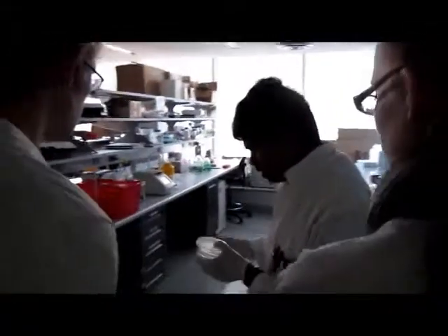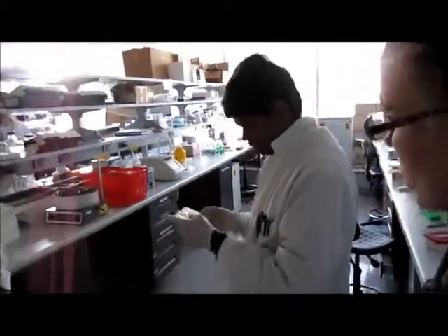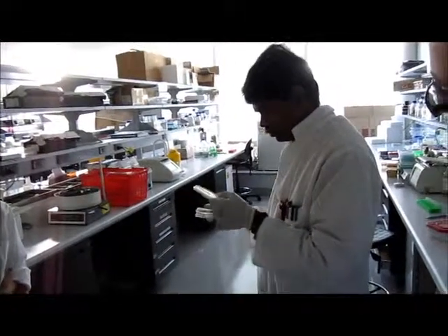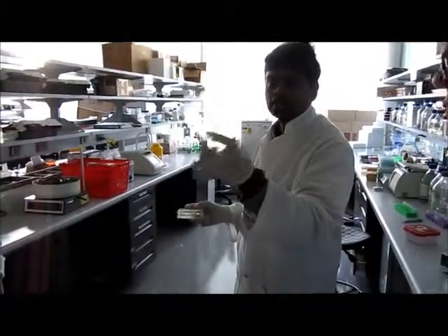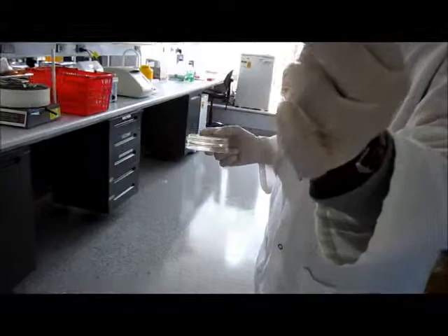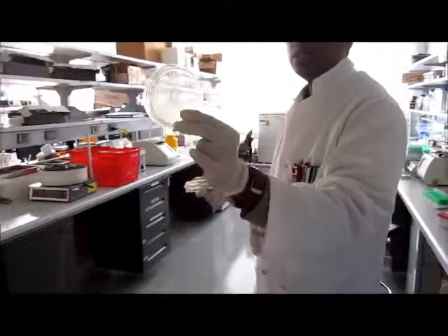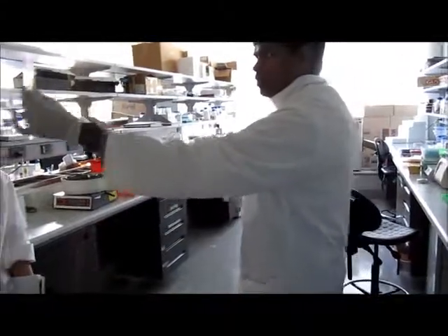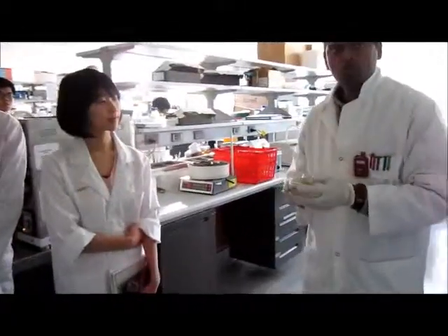Yesterday we did the transformation for PMK RGD and PMK MAC 1 as well as PLP1. Yesterday evening we did a transformation, and these are the plates. It's growing, but you see the colonies are really tiny, because it was just overnight. In the afternoon you will see the colonies will be quite big. Can you guys see the small colonies? It will be bigger later this afternoon. So we have to work with this one as well.